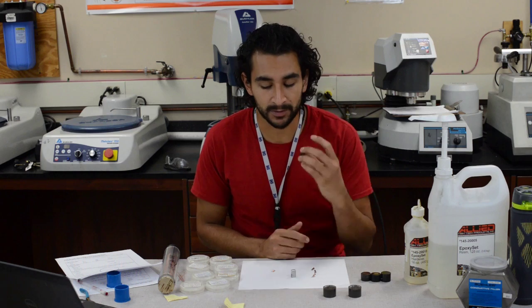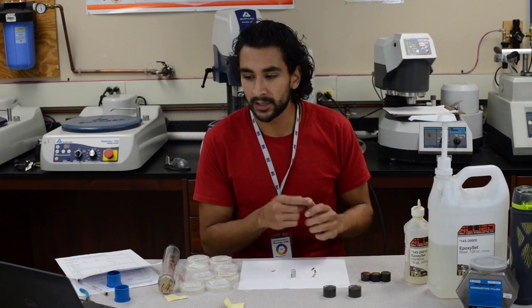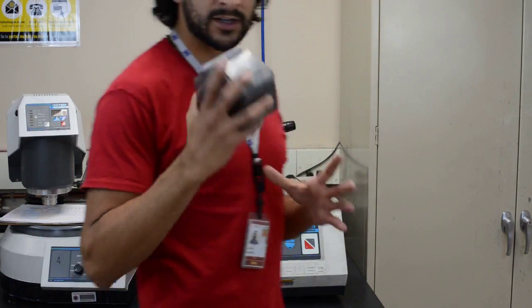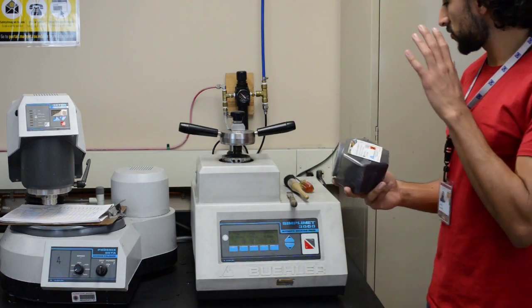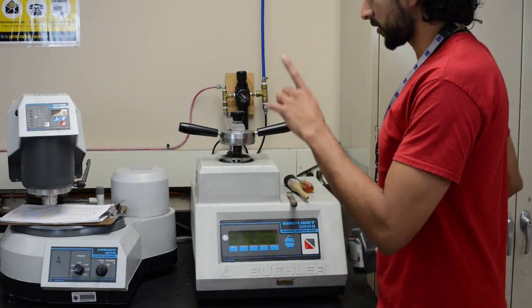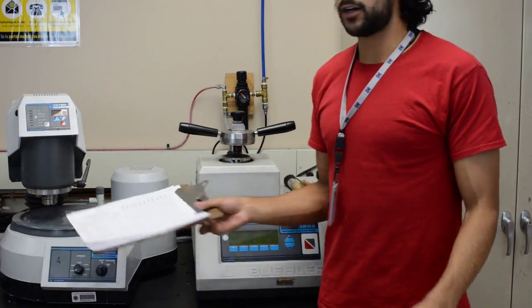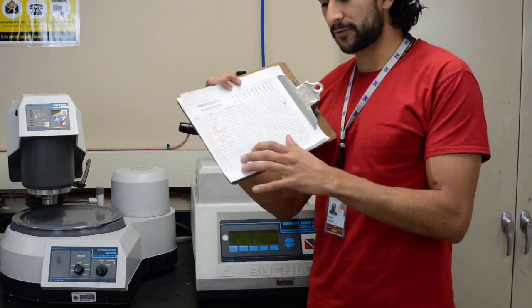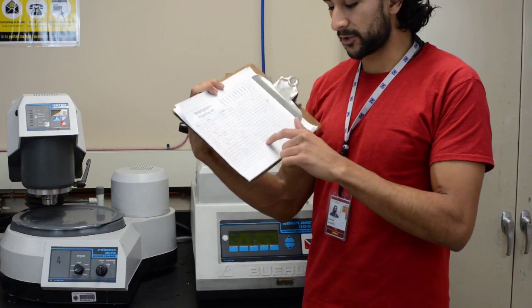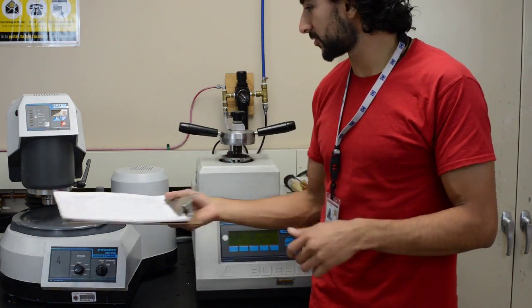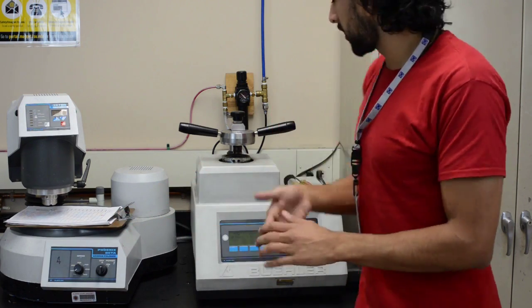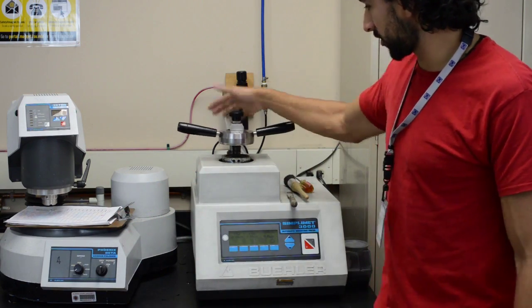So how to make this dummy puck? To make this dummy puck, you need this machine right here. Let me grab my conductament. And what you're going to do is actually first log in. Anytime you use any machine in this room, you will have to log in and make sure you check the machine that you're using. I already did that.